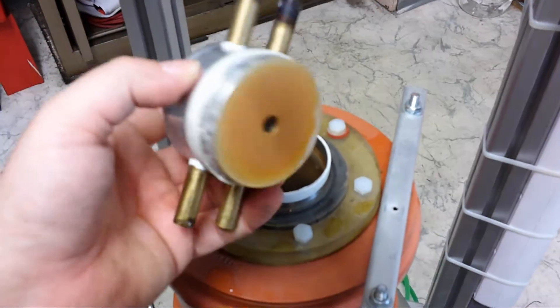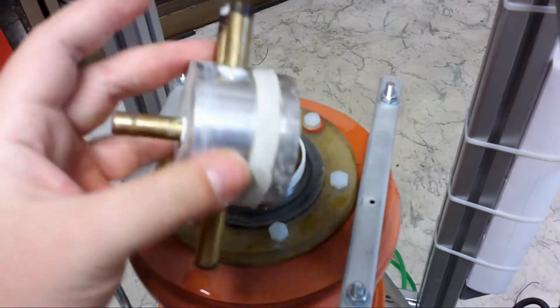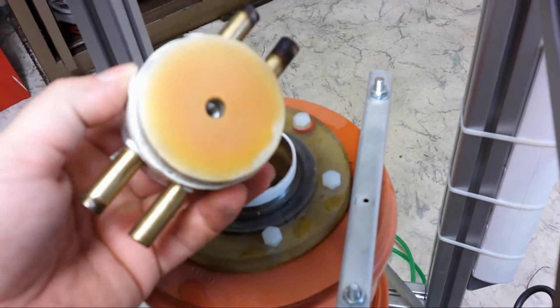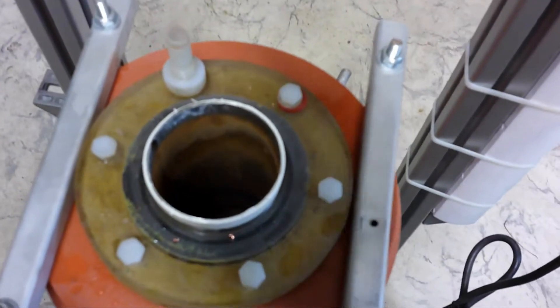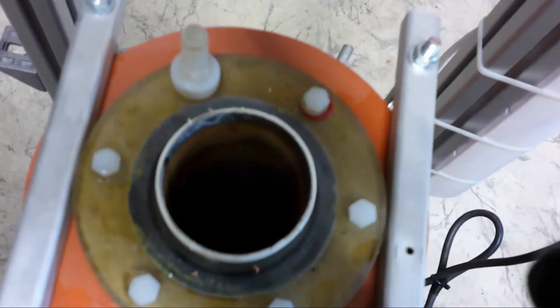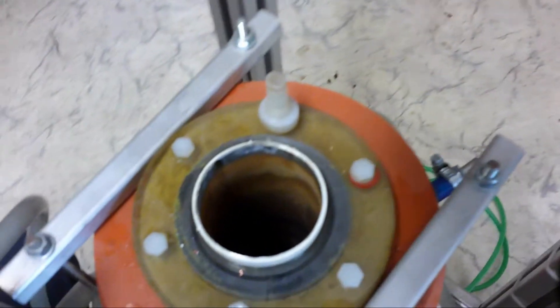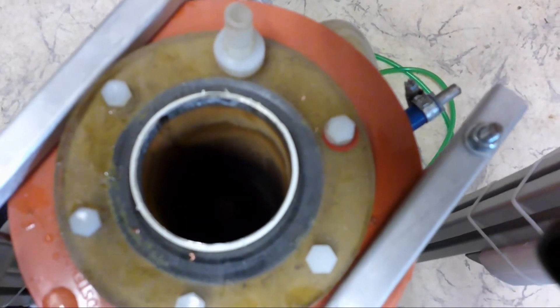So finally I managed to get the lid down. Here is the water cooled lid and here was the air inlet. So let's have a look inside into the plasma chamber. I think you don't see a lot here on the video, but it will get more clear once I open it up completely.